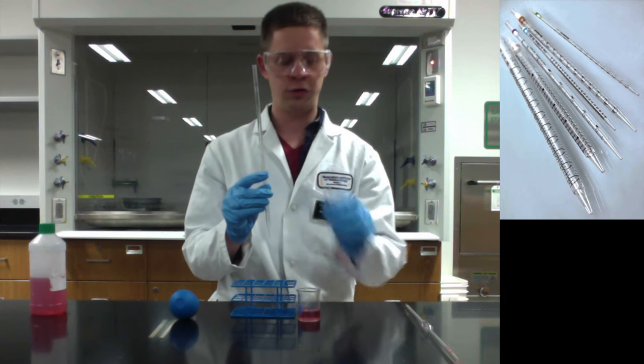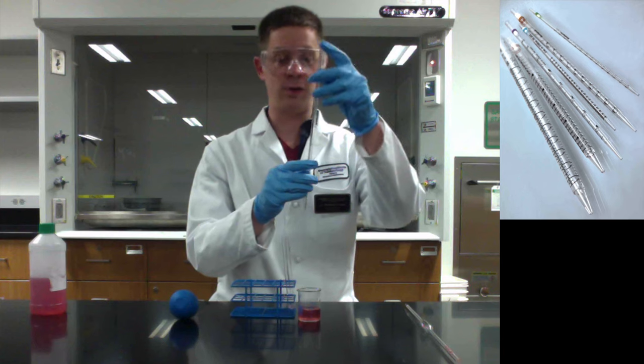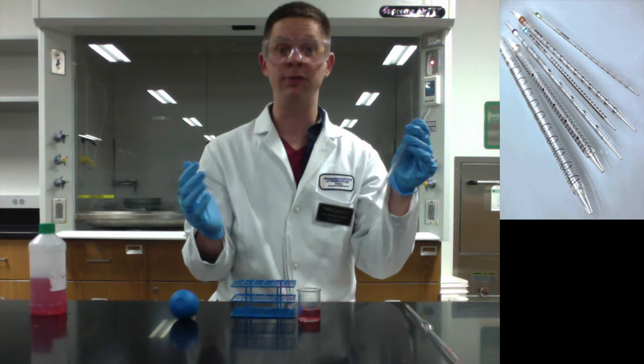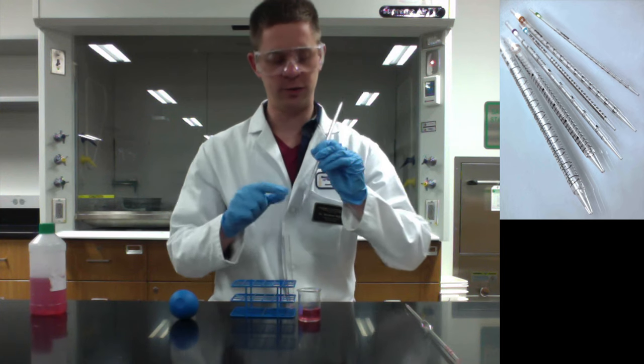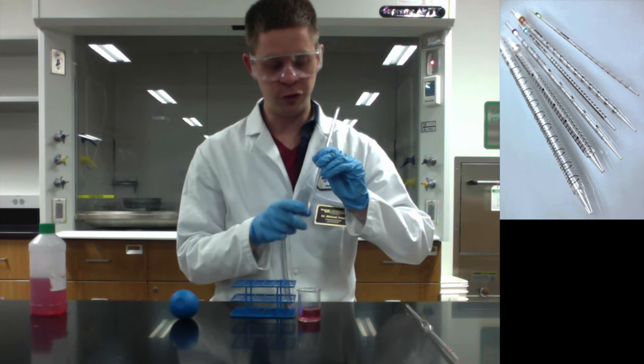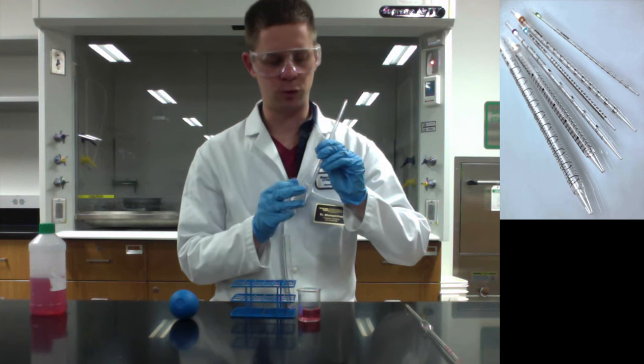So if you would rather fill to a level and then just deliver everything, you can do that as well. So for example, the smaller numbers on this serological, there's no zero level. Zero is nothing in the pipette. We'll talk a little bit more about that in a second.